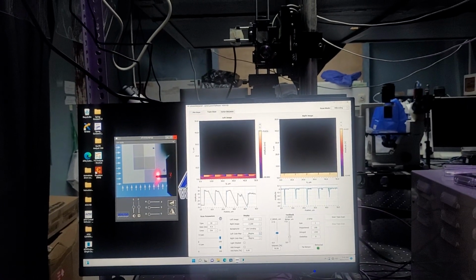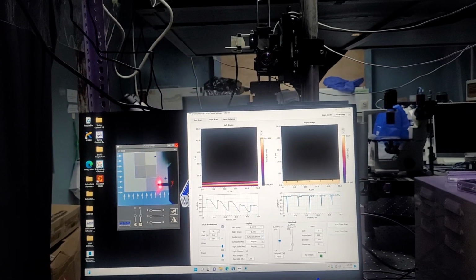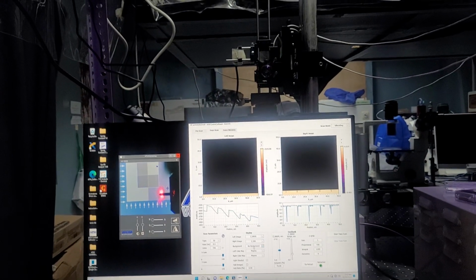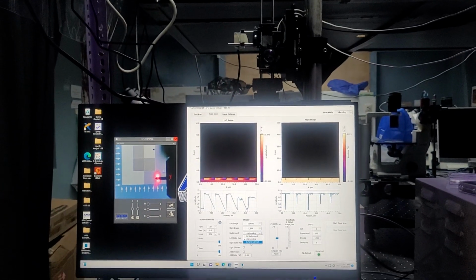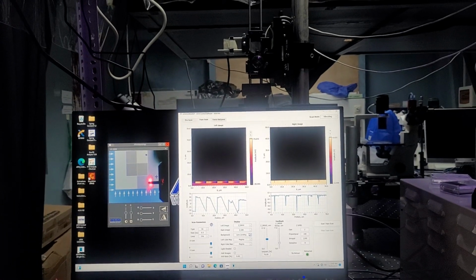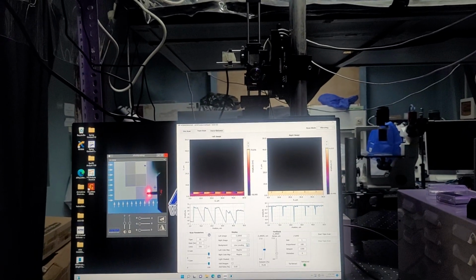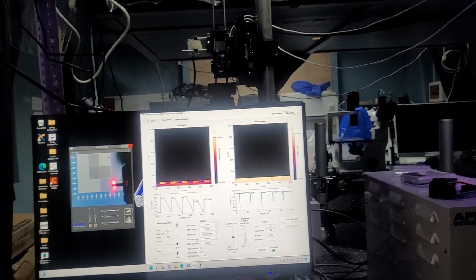So you have the option of line leveling and surface subtract. In this case it looks ugly because at the very beginning we weren't scanning anything. But typically for this kind of sample, surface subtract will be the nicest. And then typically for any other types of samples where it's not repeating features like this, the line leveling will look better. But again, it will not change the actual data that's saved.